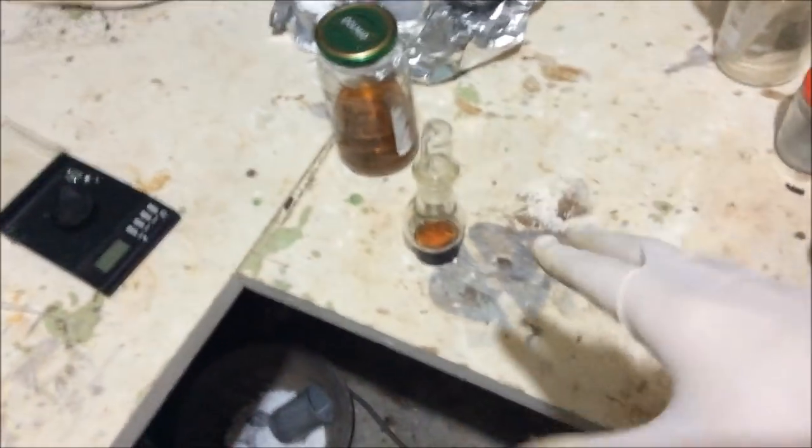Now, I've been so doom and gloom about this that I forgot to mention that we actually have achieved our goal. We have made benzene here, a very hard to obtain carcinogen, from the most available material, PET plastic. I'm getting all shitty about my yields, but the reaction has actually worked. We have done it. We've turned a non-chemical item into a useful solvent. So I'm patting myself on the back here, but I'm just pointing out that before everyone roasts me for my yields, this method does actually work, and we have actually achieved our goal of this project. But from now, it's just about purification so that we actually get usable products out of this, so that I can actually do chemistry with the benzene.